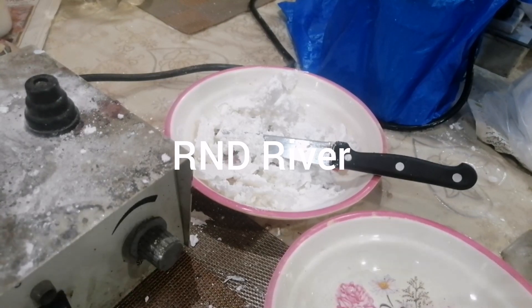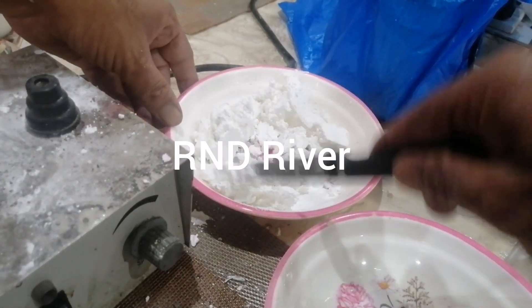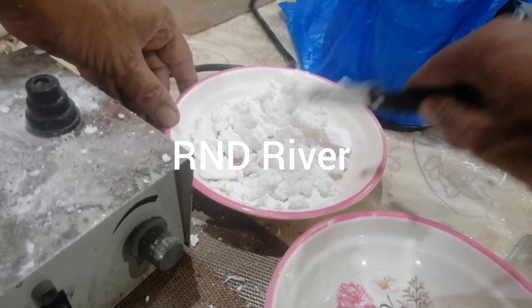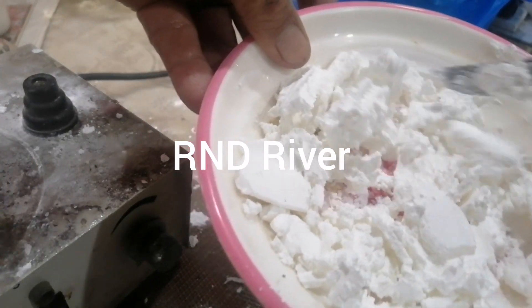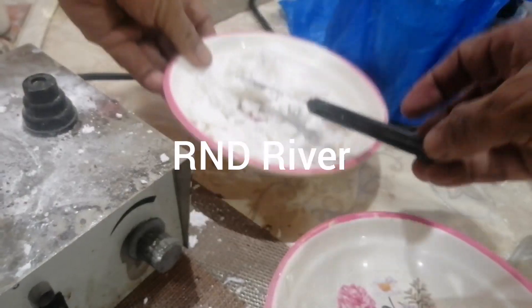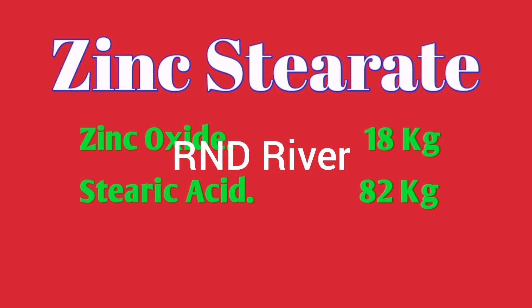When you grind it, it will become a lightweight powder. Now the product has been finished. This is Zinc Stearate. The formulation is: zinc oxide 18 kg and stearic acid 82 kg. I repeat — zinc oxide is 18 kg and stearic acid is 82 kg. If you feel this is a useful formulation, it is a good formulation.